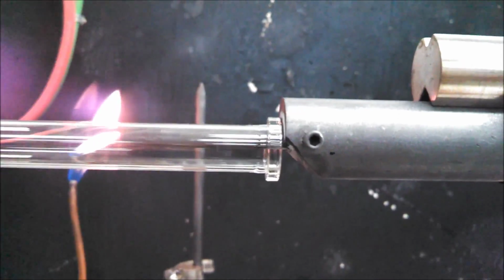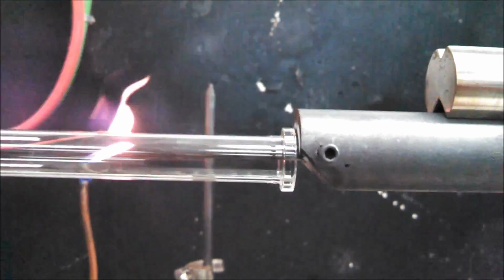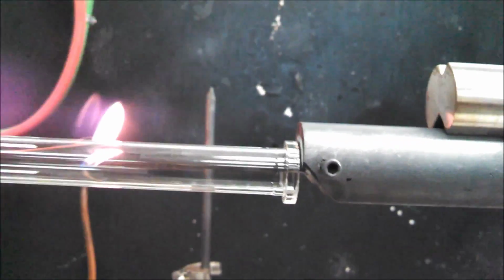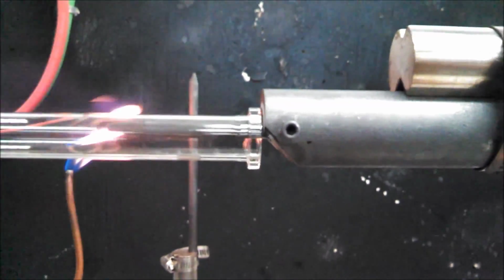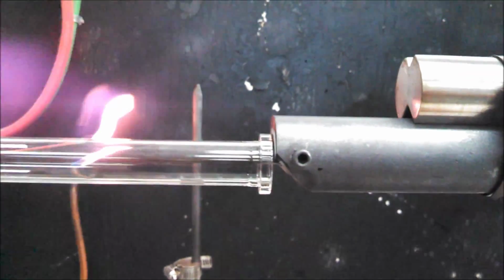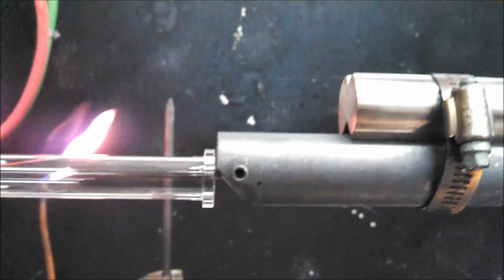And you'll be able to tell when it's going around if there's any shimmering, or you'll see an edge not quite filling in. You just add a little more glass, and when you're done, it'll go around with no shimmering, and the flange will be flat on both sides and square. Hope you enjoy.